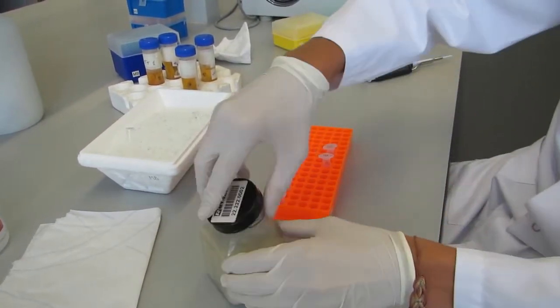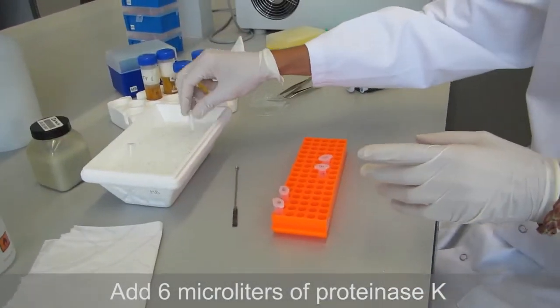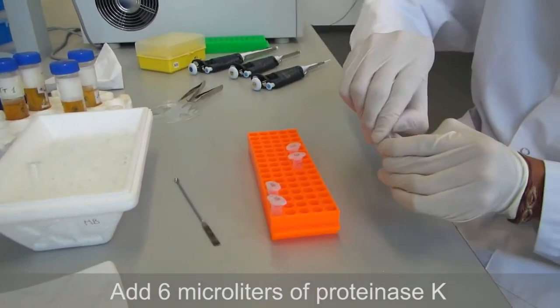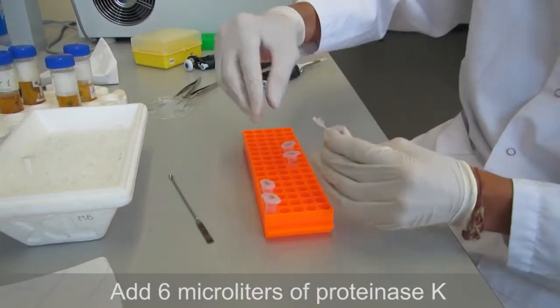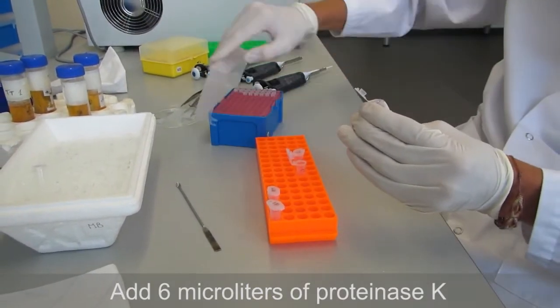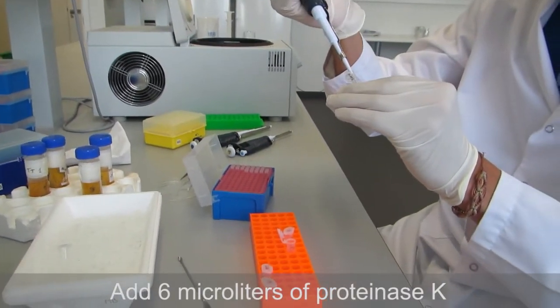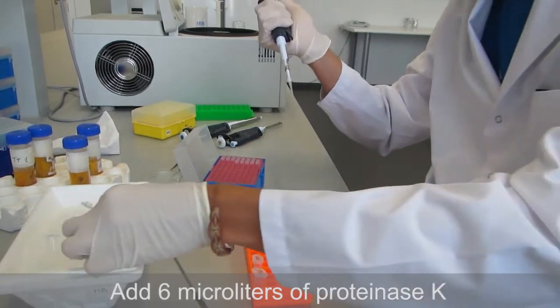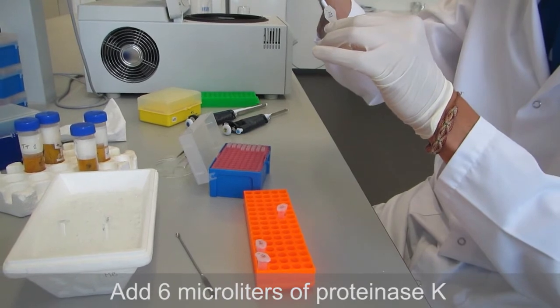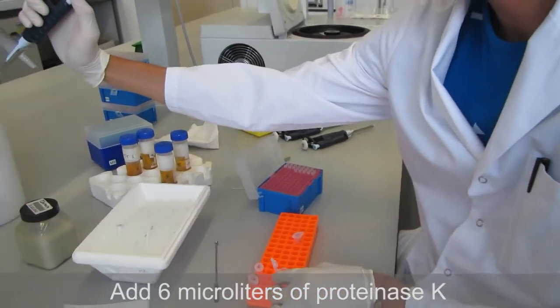And also some proteinase K. And these two together they will further break down cells and release DNA from the nucleus. So we will add only 6 microliters of proteinase K. It's an enzyme so we keep it on ice. Otherwise it will break down fast.